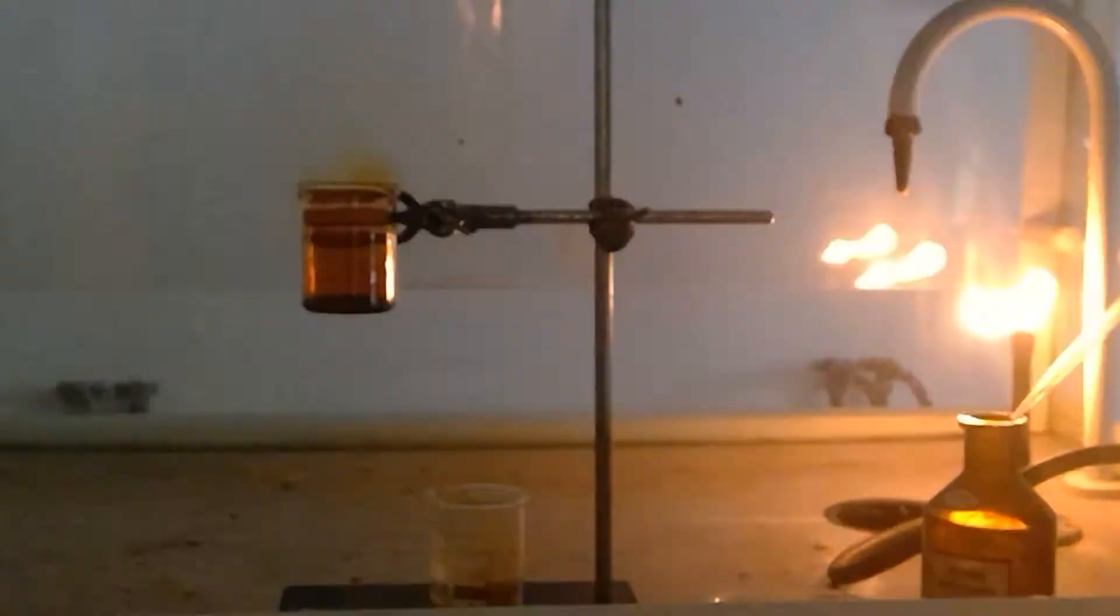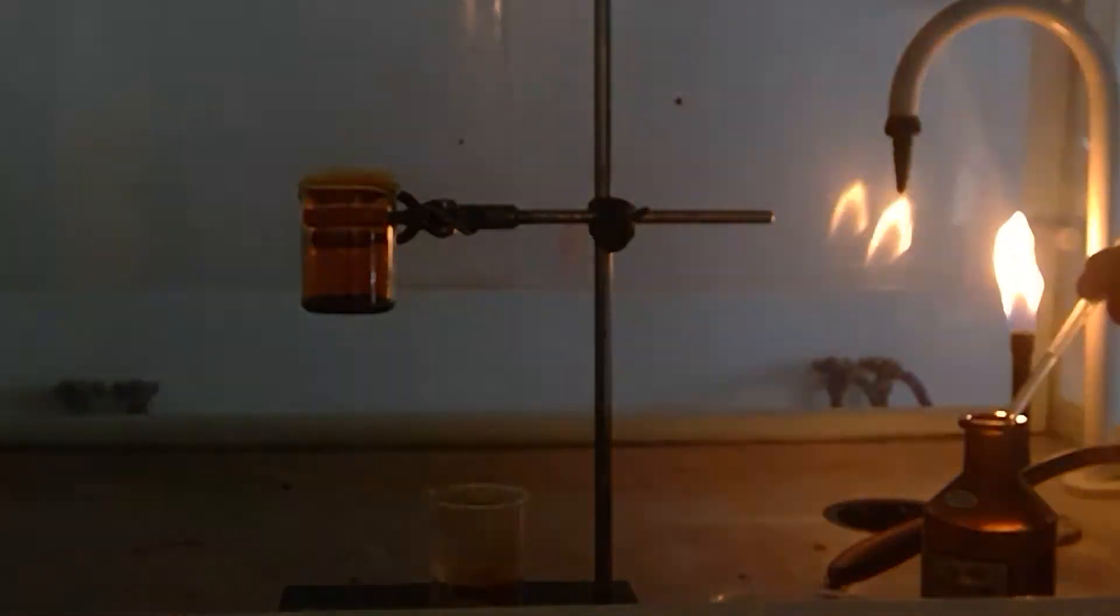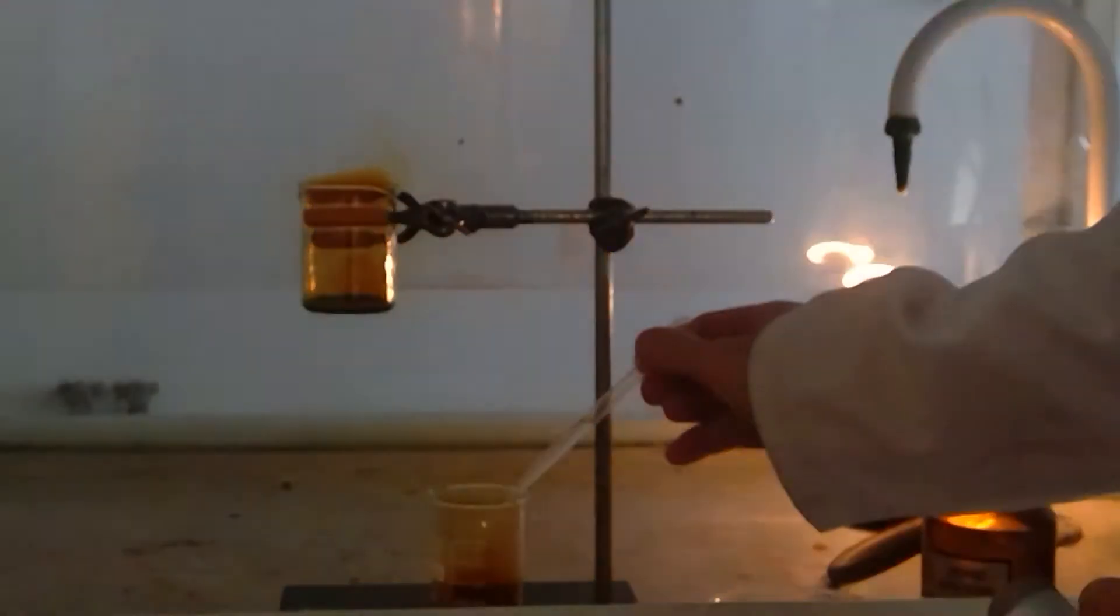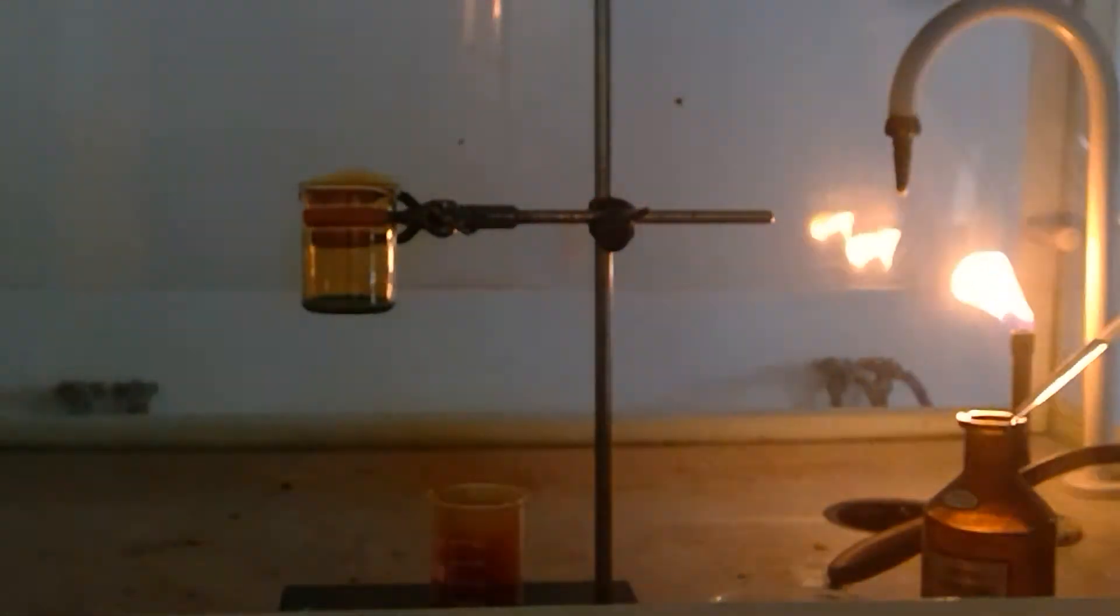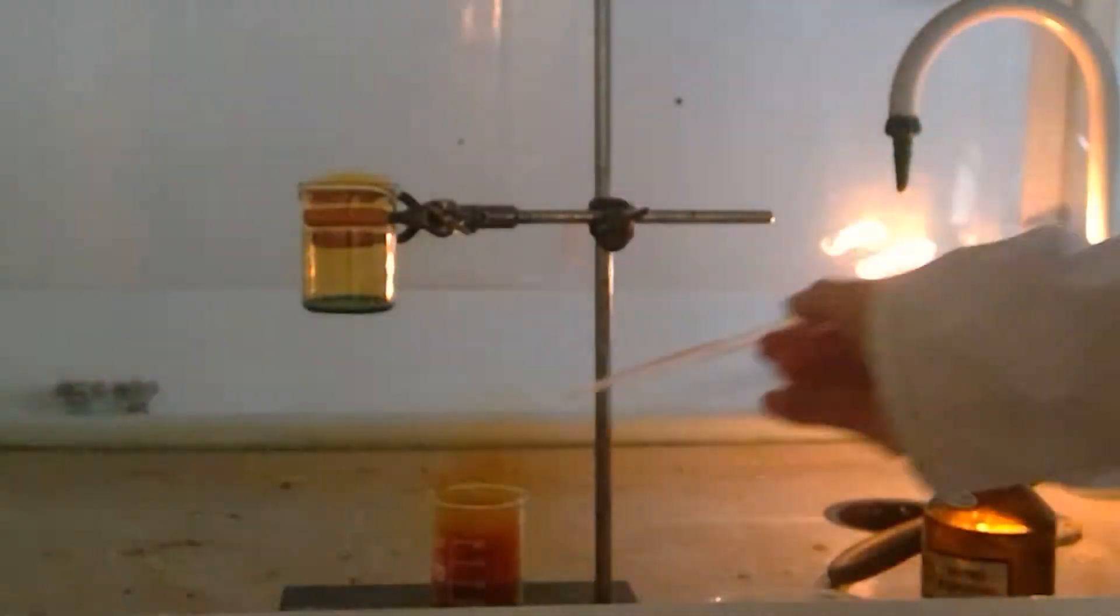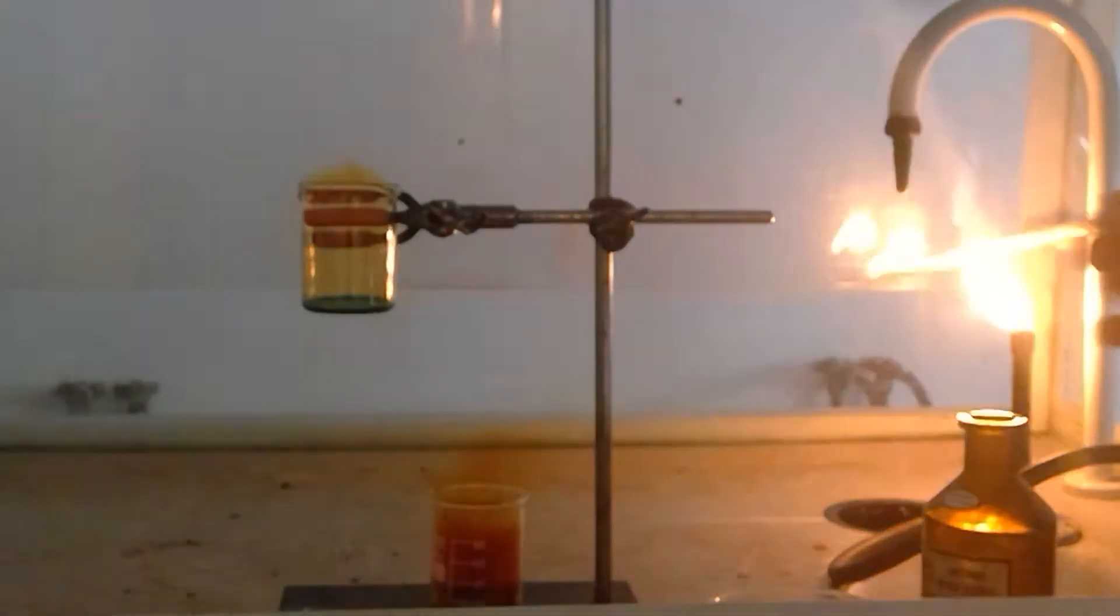Much slower because it's not 100% copper plus it has a much smaller surface area. As it's produced more slowly it will be easier to see the blue color of the solution at the end.